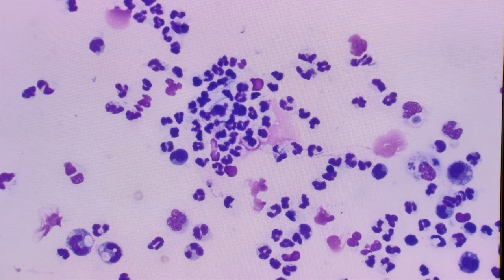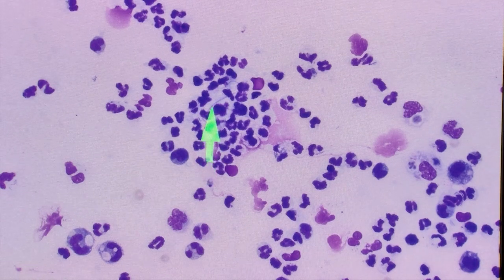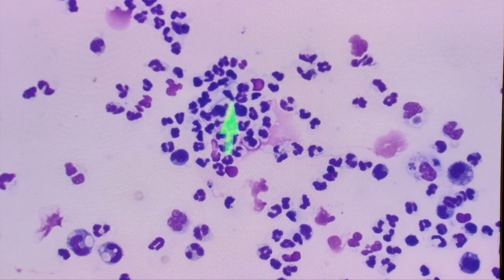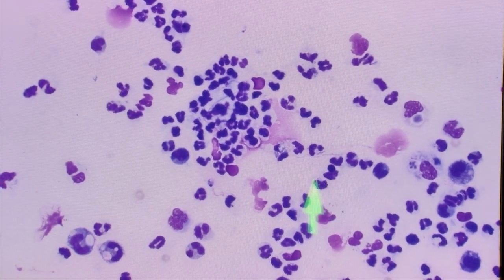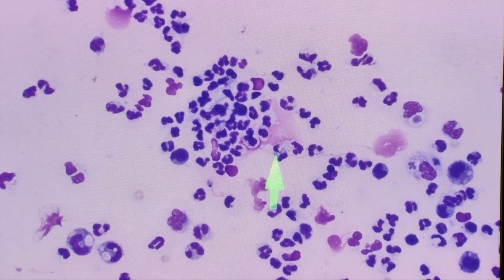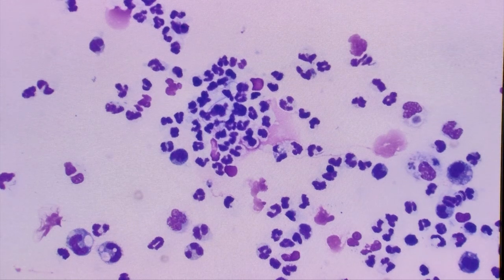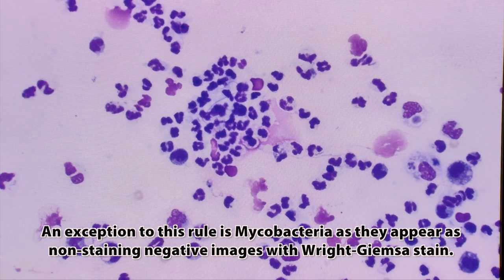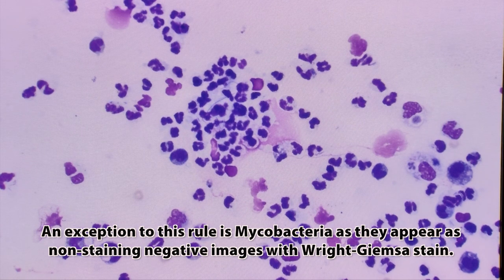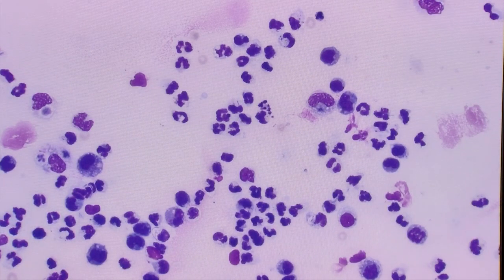We can also start to notice organisms at this power. Right here we've got a long filamentous slender bacterial rod that is outside of the cells, and there are other instances where we can see bacteria within the cytoplasm of a neutrophil. This is a good time to point out that this is a Wright-Giemsa stain, so all bacteria will stain a dark blue color. This is not a gram stain, so to determine if your bacteria are gram positive or gram negative you would have to use a different stain called a gram stain.